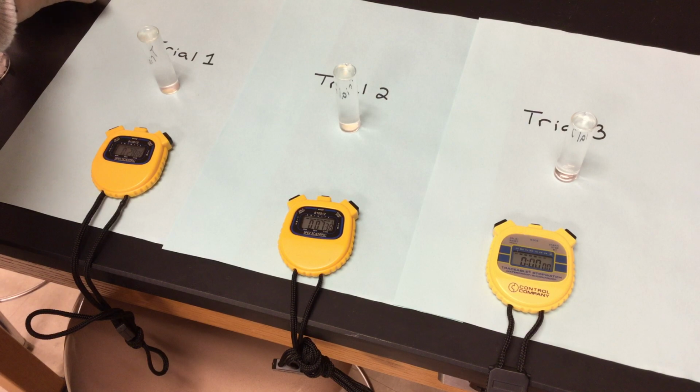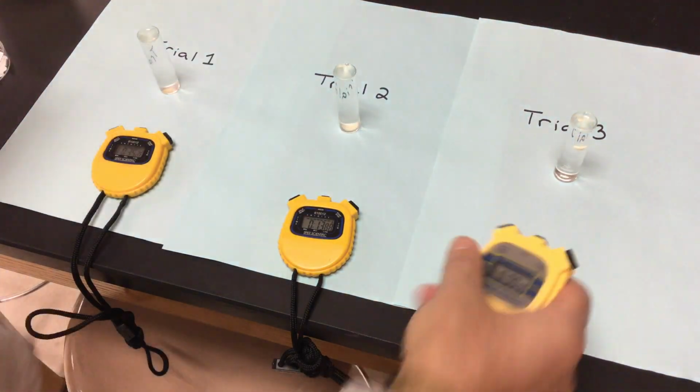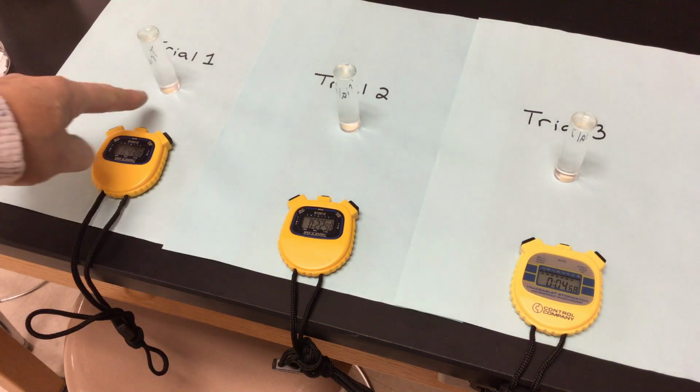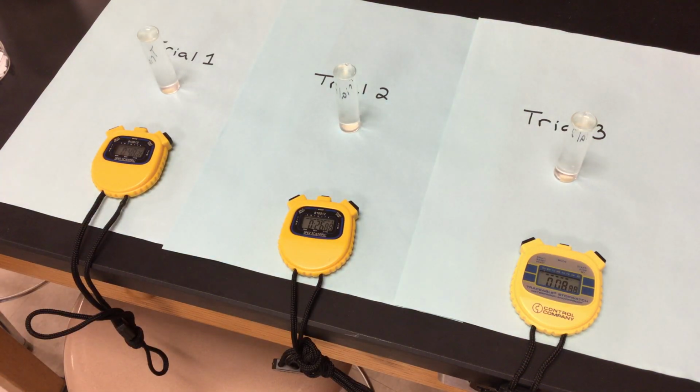It's just with us doing 3 trials. We want to make sure that we are running all 3 at the same time, so this video is not super duper long. If you guys were in class, you would be running 1 trial, and you would then be sharing data with other groups. So we're going to let that go. Right now, this is at a pH of 3. My little discs are at the bottom, and we are going to let them sit there for a little bit.